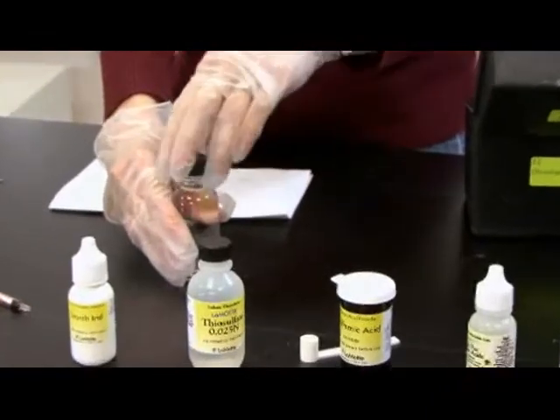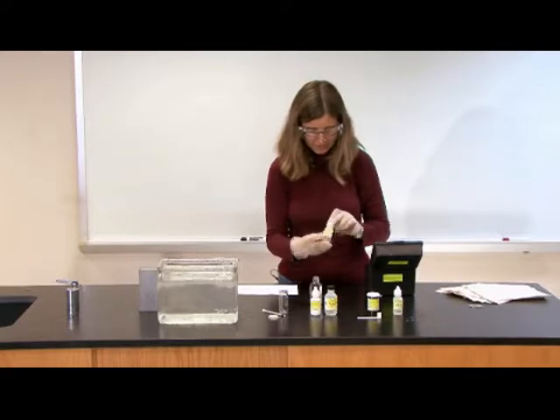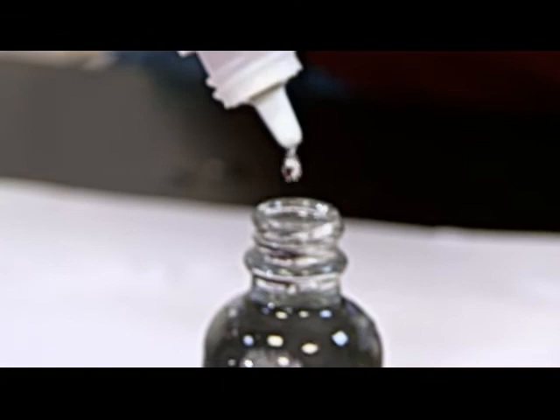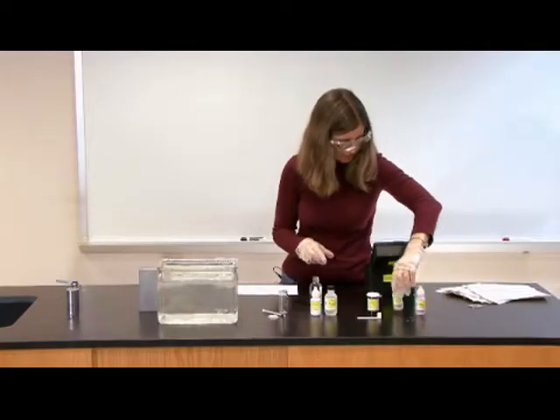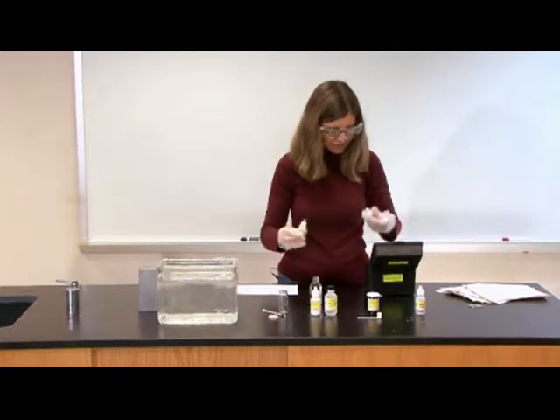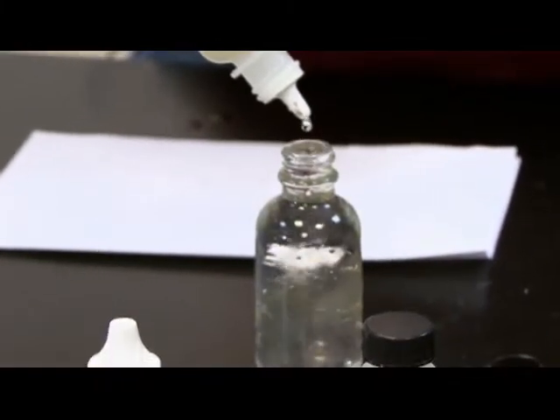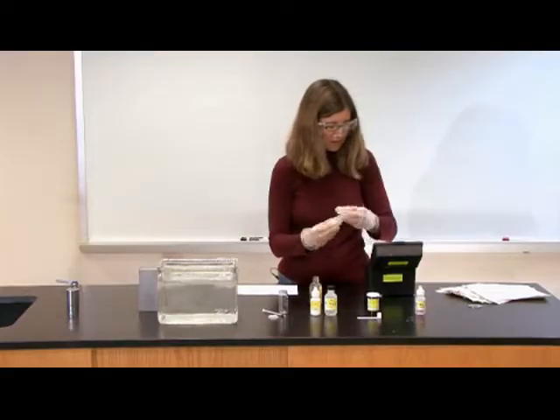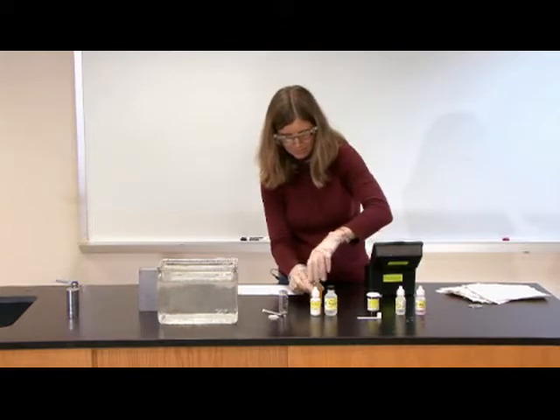The first thing you do is open up your sample and add eight drops of manganese sulfate solution. And this all comes with the kit. Then I'm going to add eight drops of the alkaline potassium iodide solution. So, eight drops.